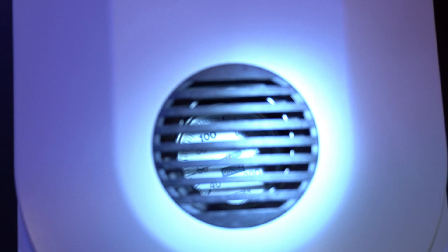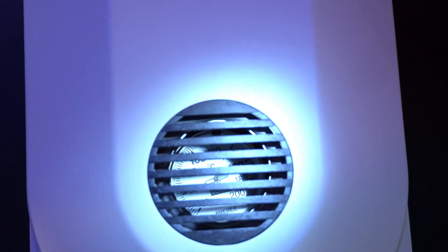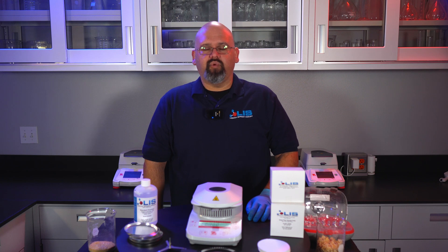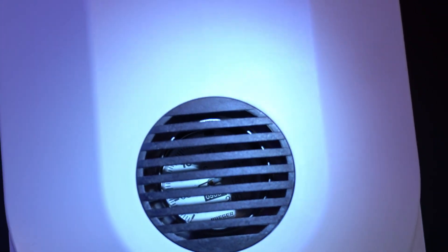You can see the temperature on the calibrator through the top vent on the lid. After 15 minutes, it will ask you to verify through the vent to see if the temperature sensor and the calibrator match 100 degrees.